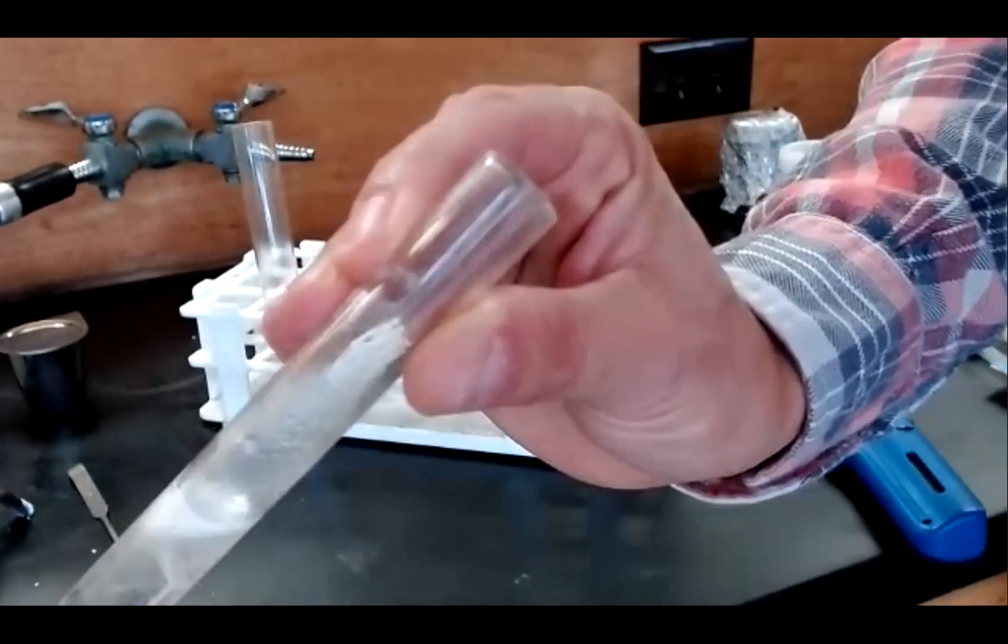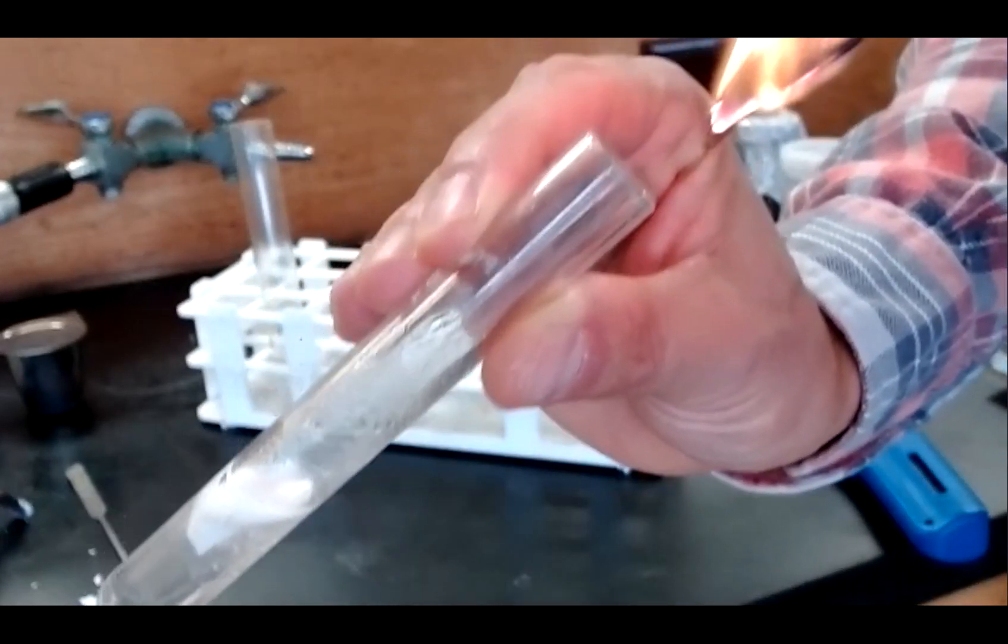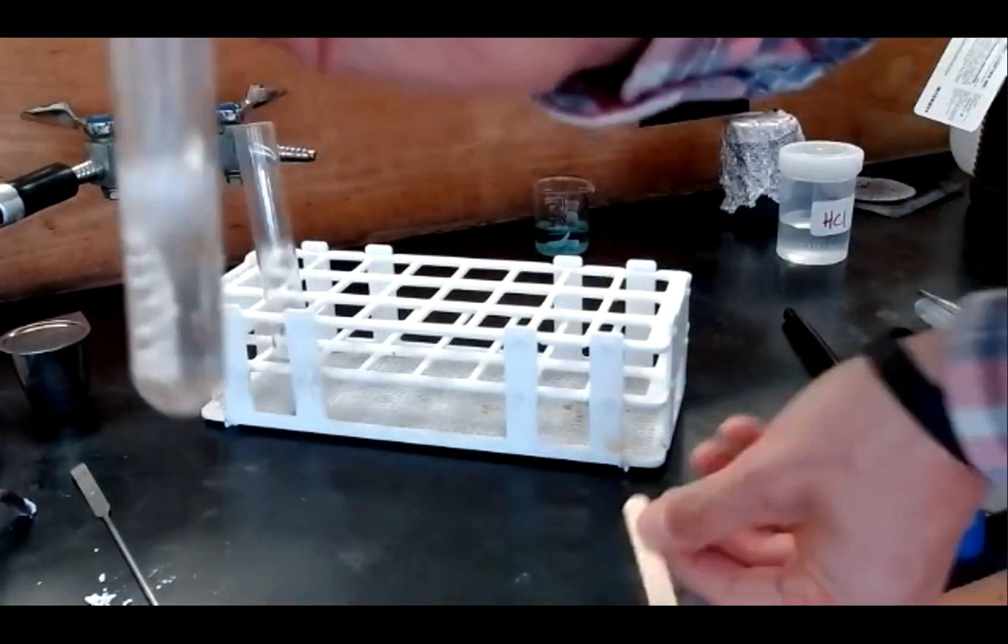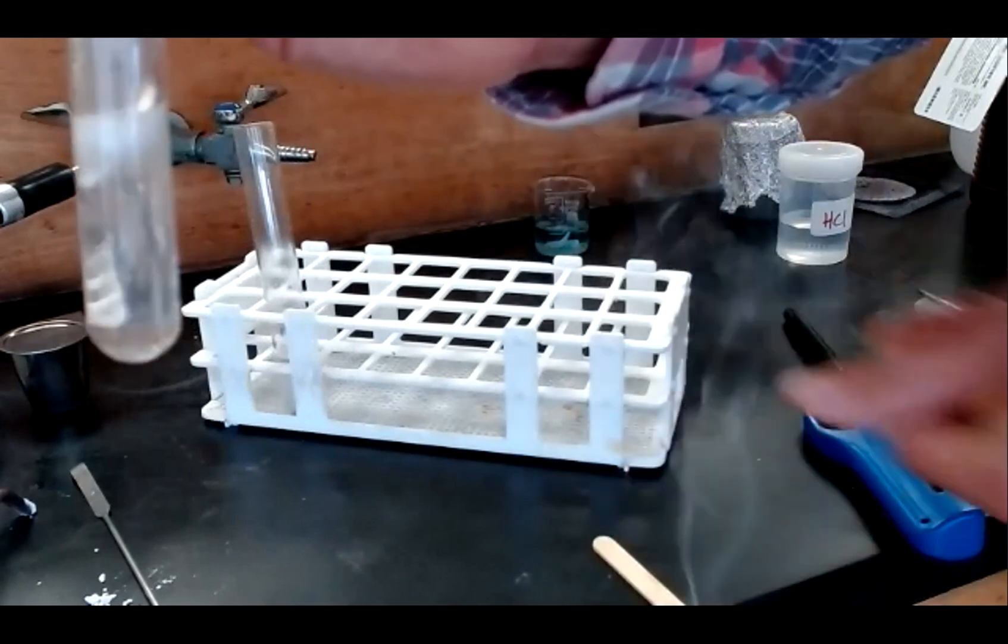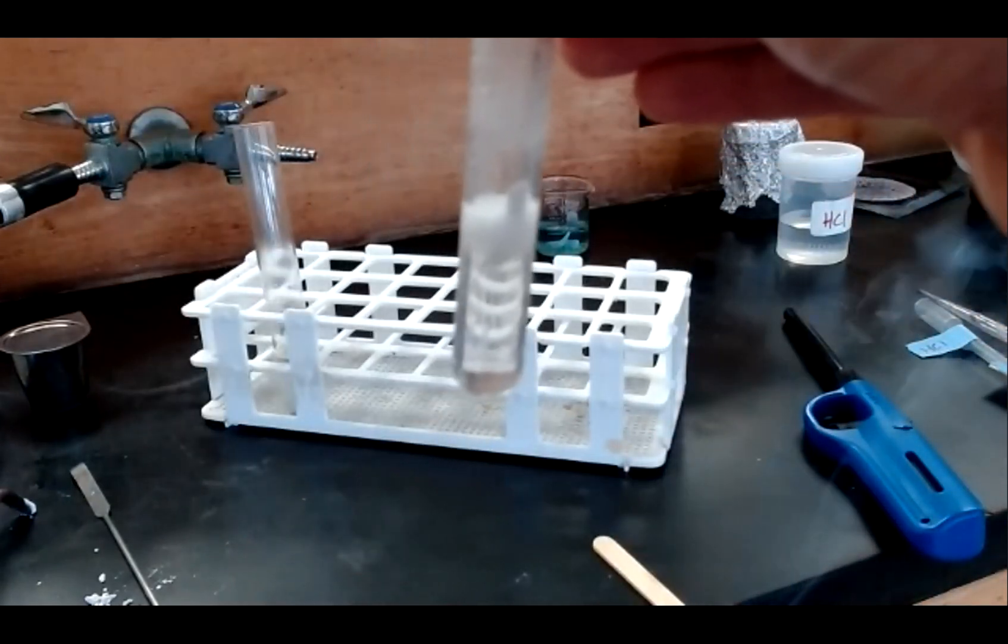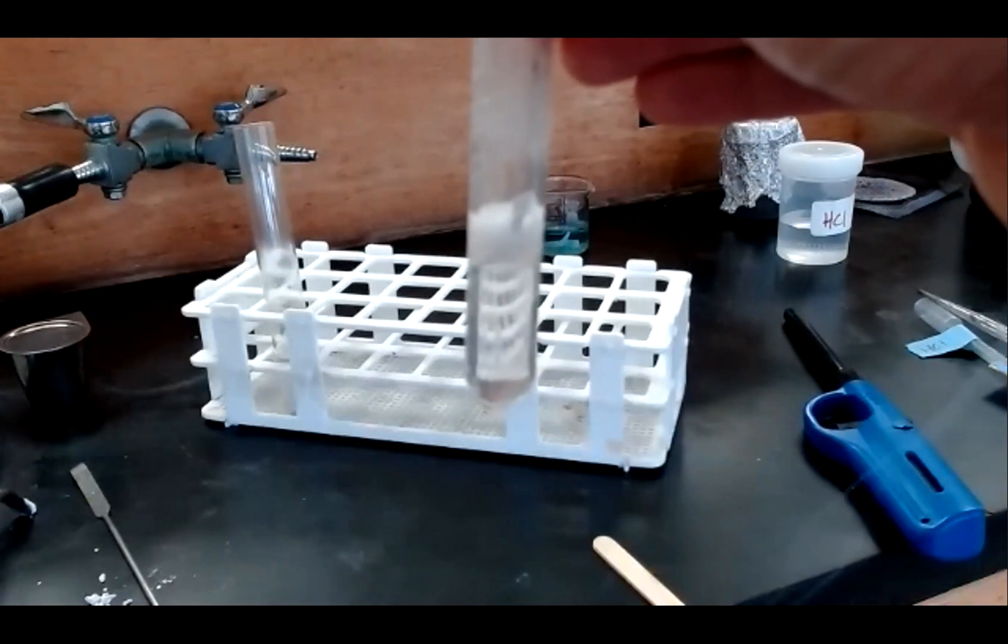Again, listen carefully for the bark. There it is. So this was the single replacement and generation of hydrogen gas and the combustion of hydrogen gas.